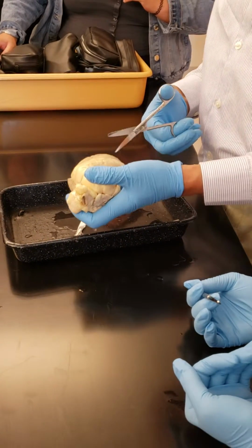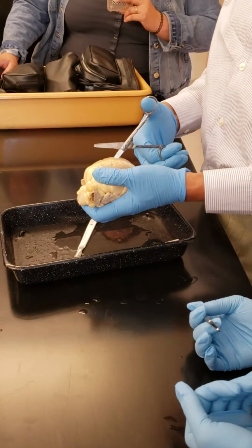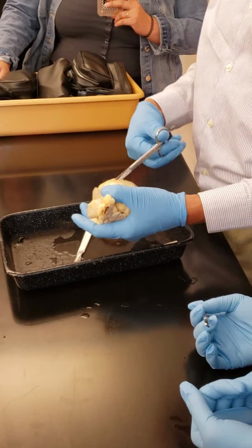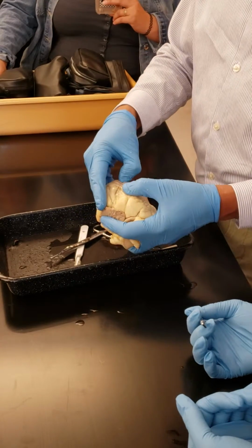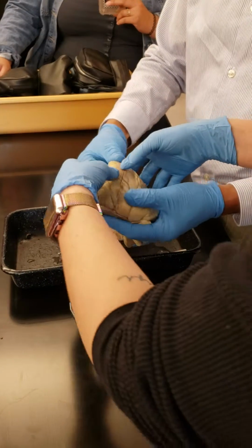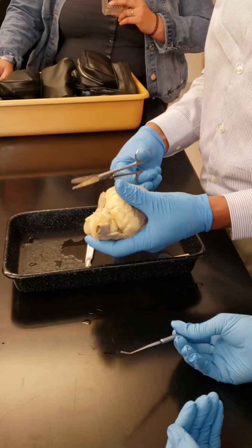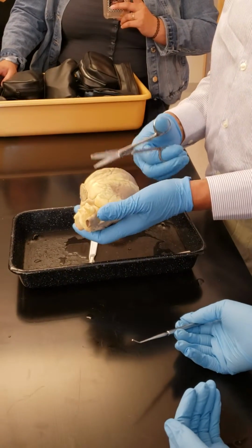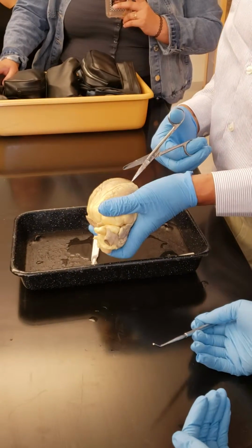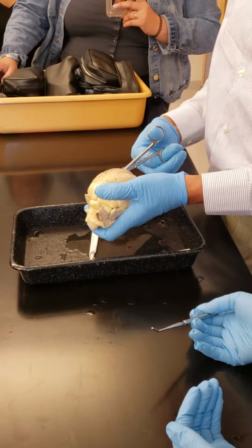Did you notice the wall is so thick? See my scissors here. See how deep it is going, right? I'm cutting it, and I'm still not through. Can you show it to them? I can't even open it. I'm not all the way in. It's such a thick wall. Left ventricle walls are the thickest because they pump blood to all different, distant parts of the body. So I'm going to cut it more. Once you are in that chamber, see, I'm now in the chamber, right? I can feel it.